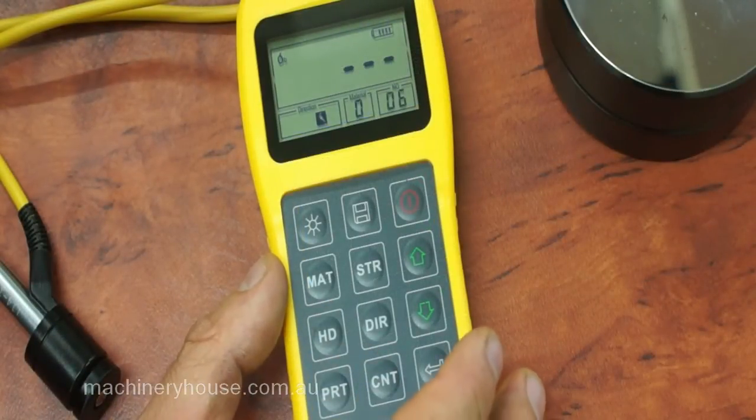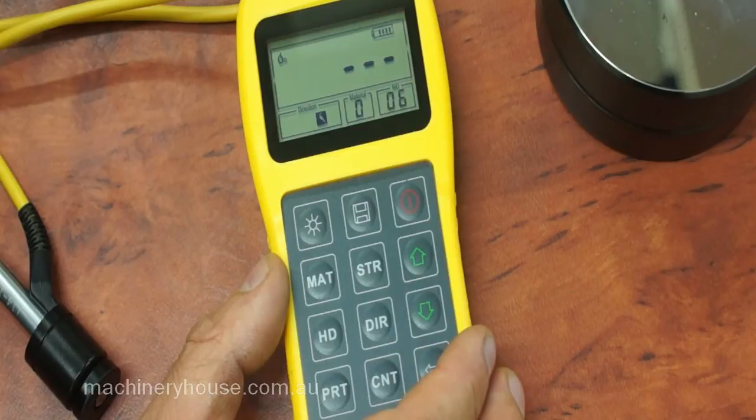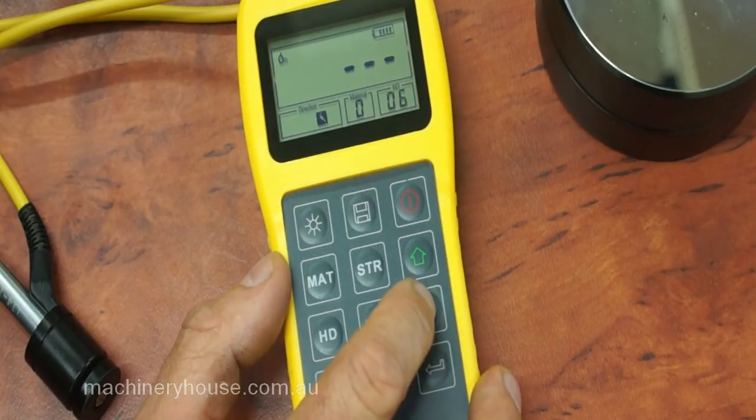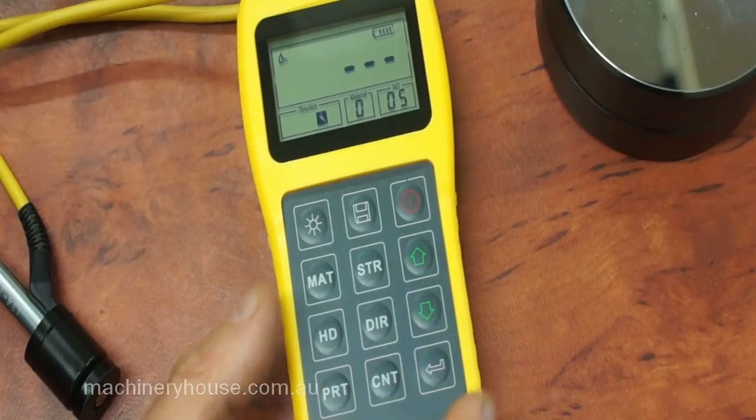The count button will give you a pre-selection of the number of tests you wish to make. The default is 5, but you can select that to anything you desire.